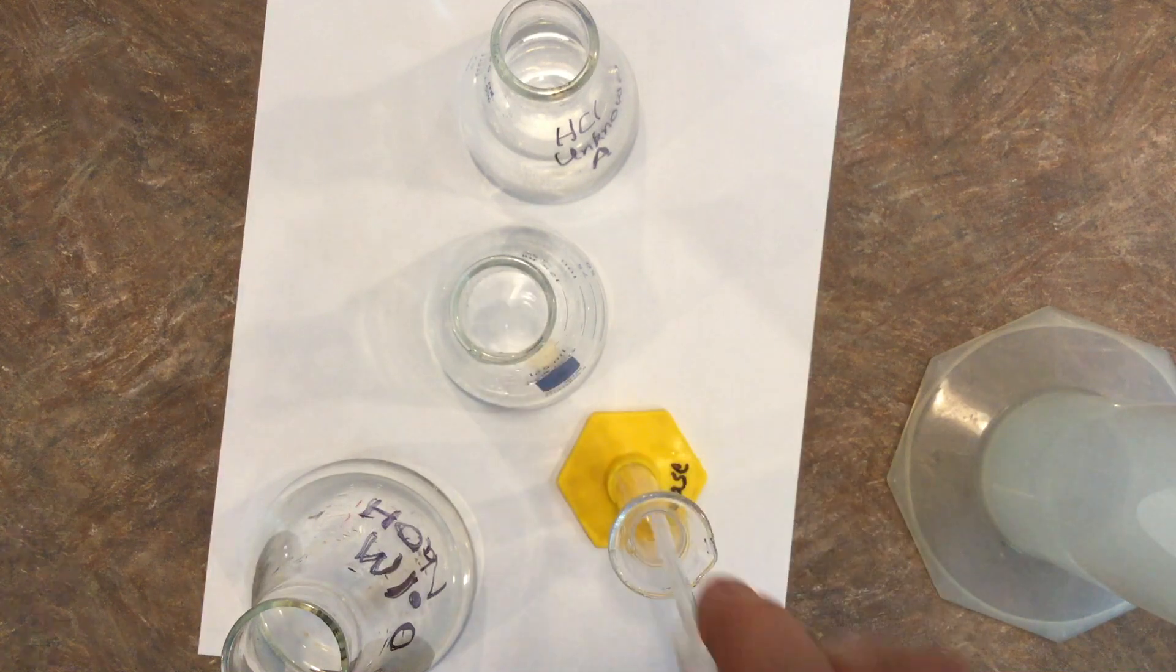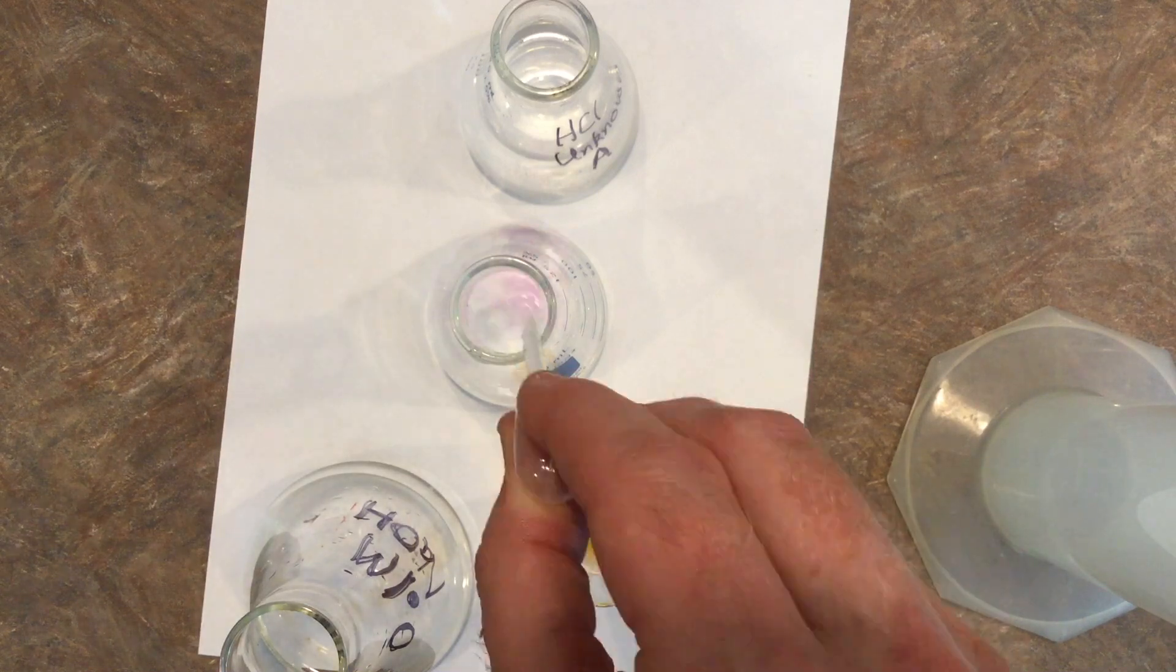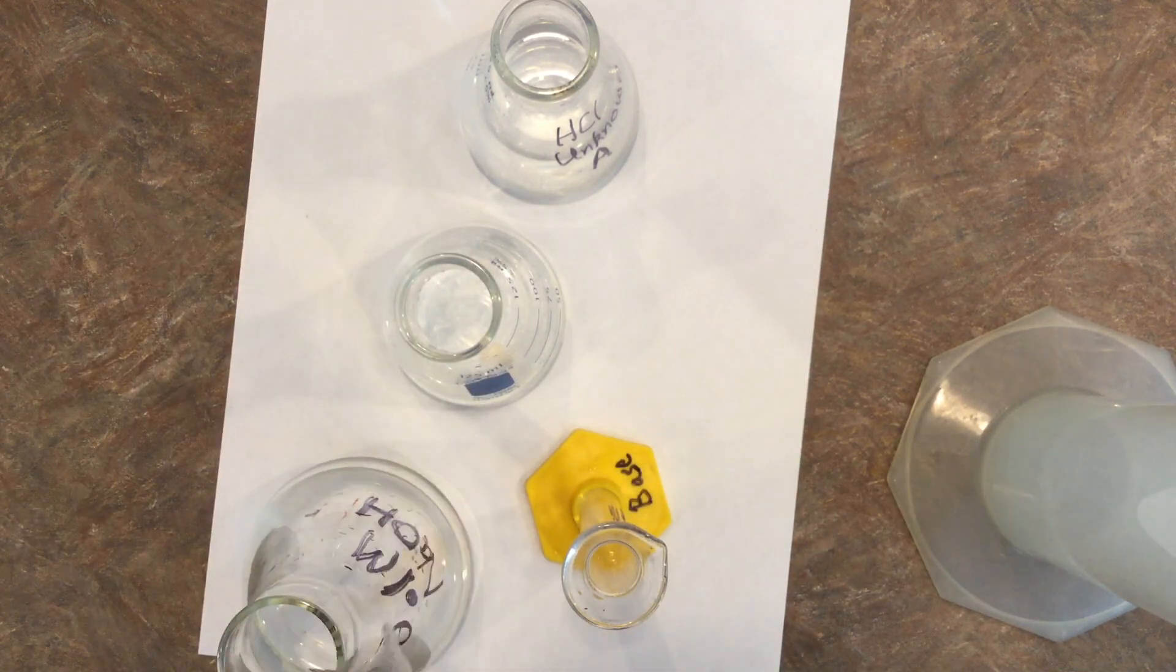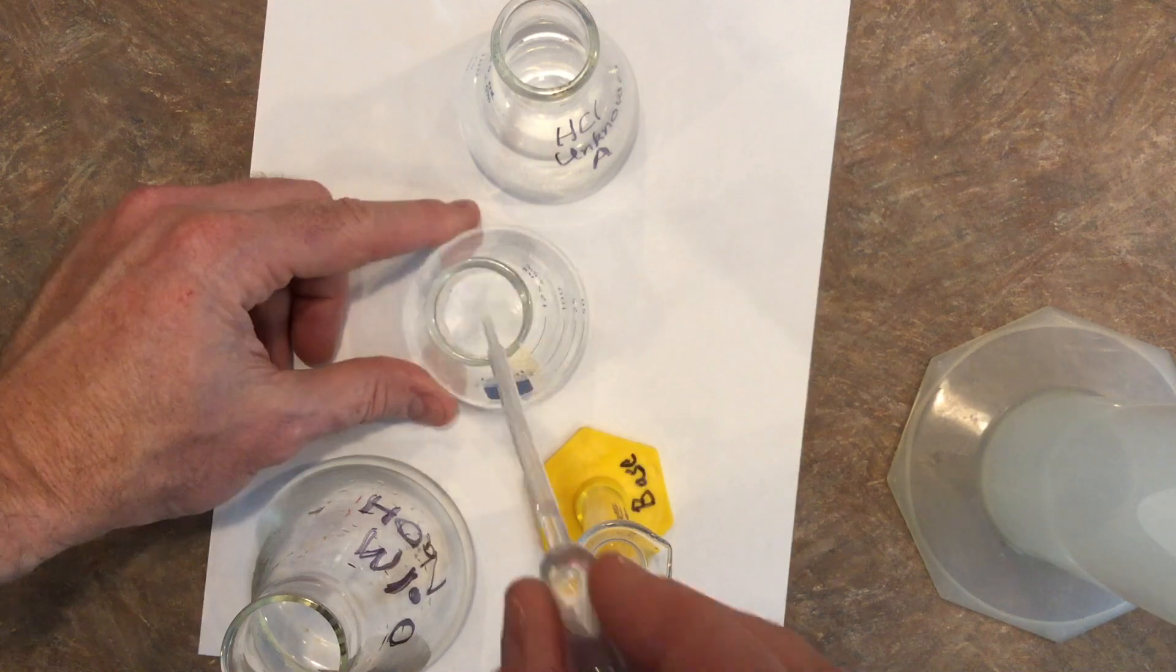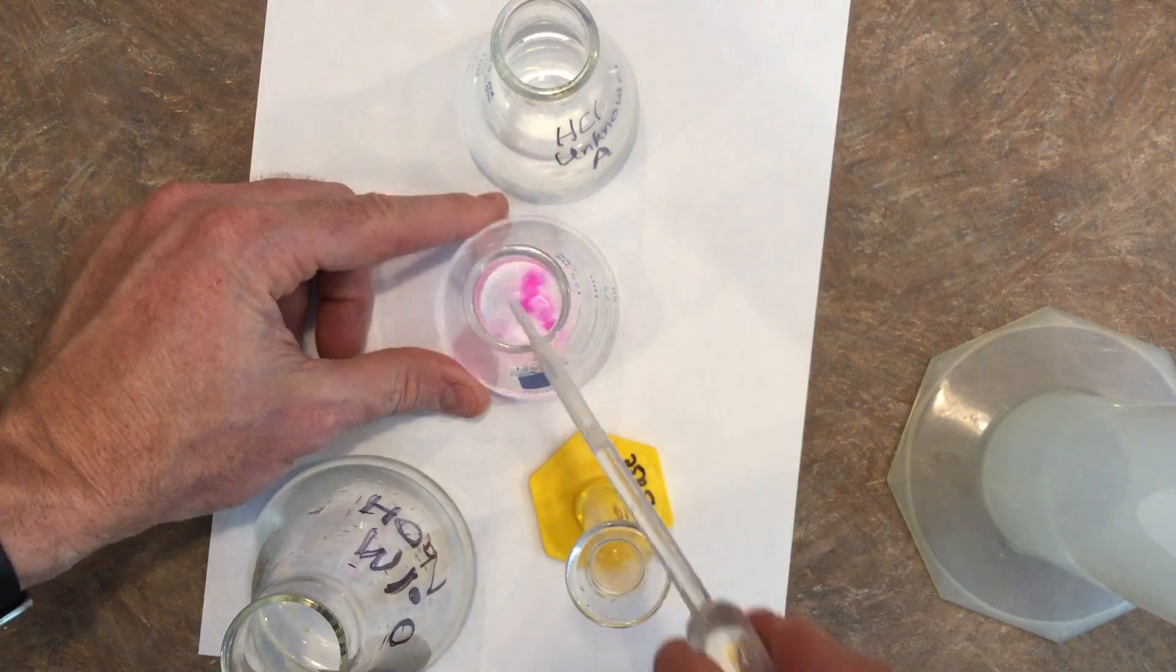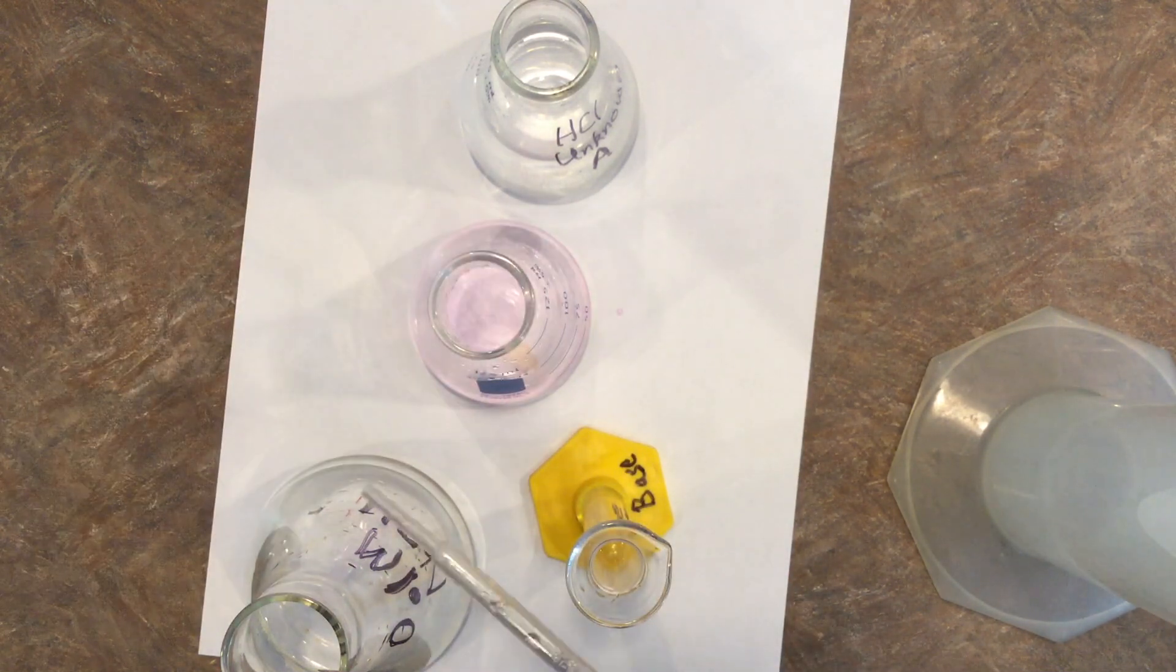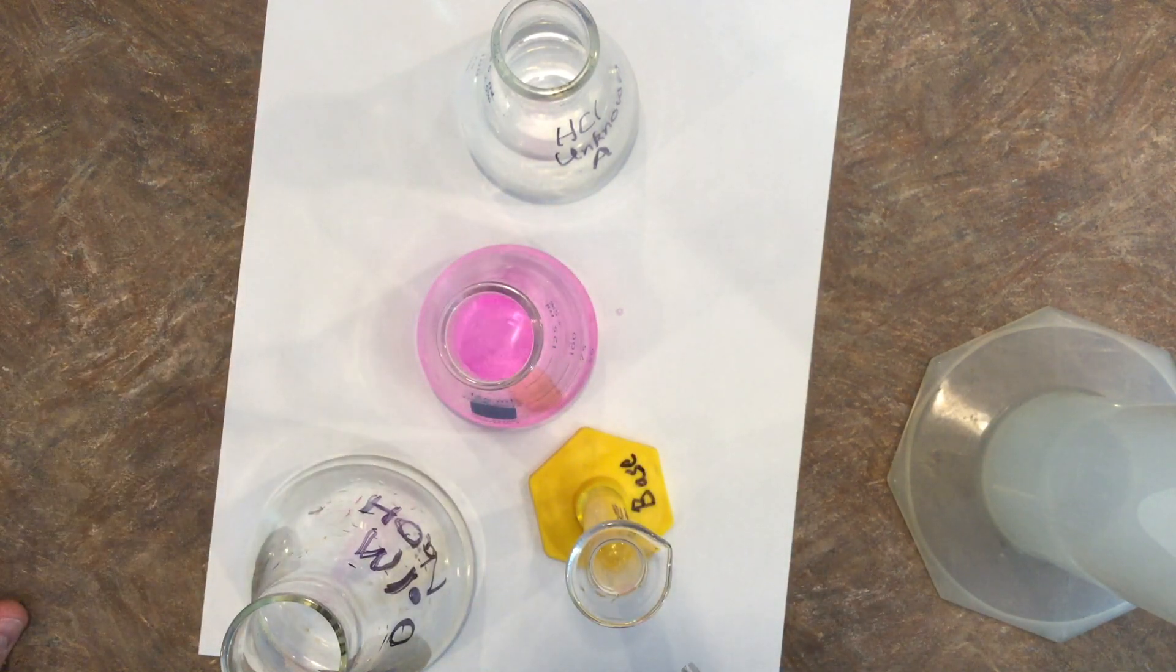We're looking for when it changes totally and doesn't go back to clear. I've used another 10 milliliters. Need to fill it up again. I'm getting pretty close, but yeah, I'm going to need to fill it up again.